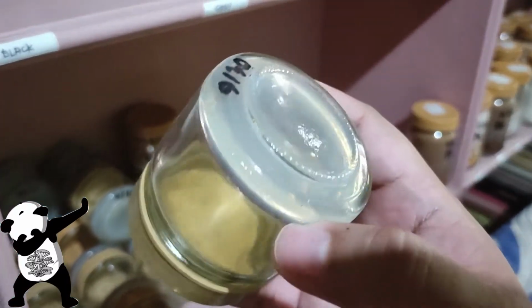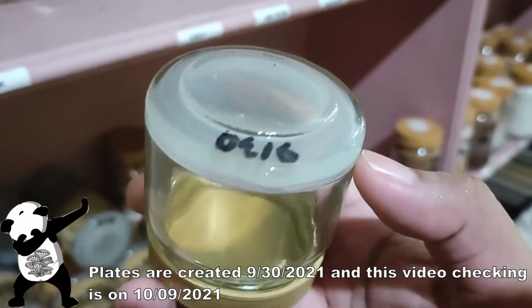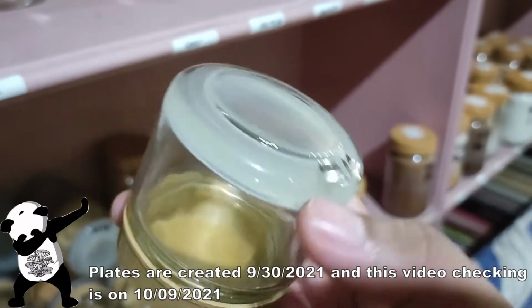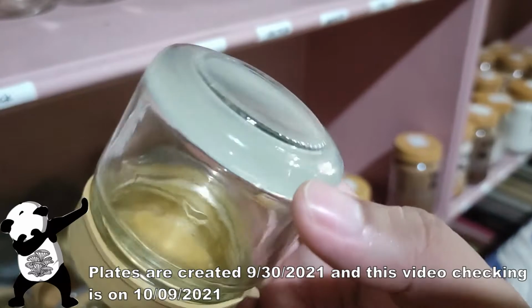What we are gonna check here today are the plates that I created September 30, and it's looking really clean. I did check the lids as well. There's no molds or any other things growing there.